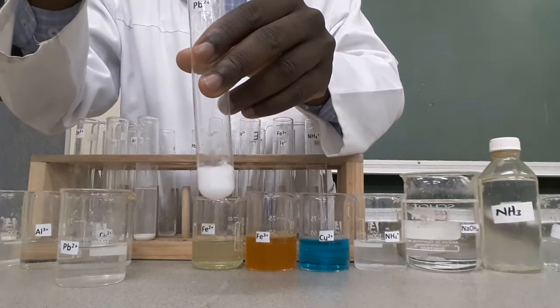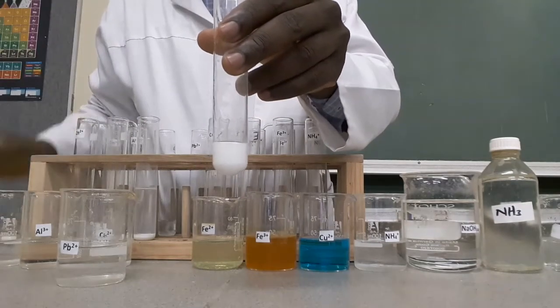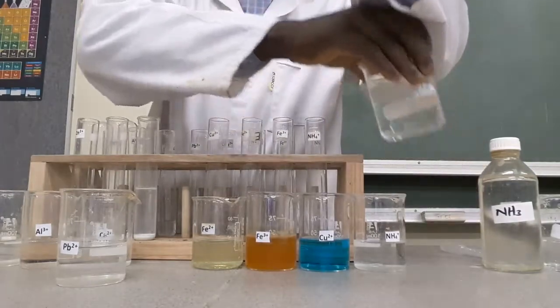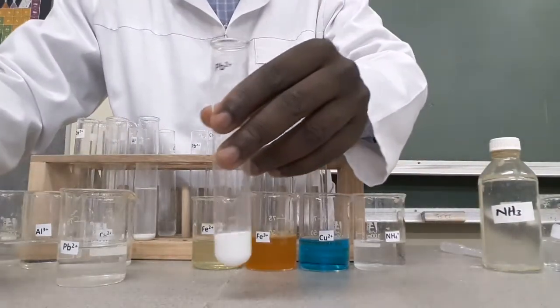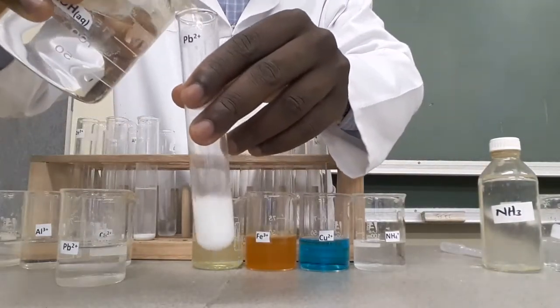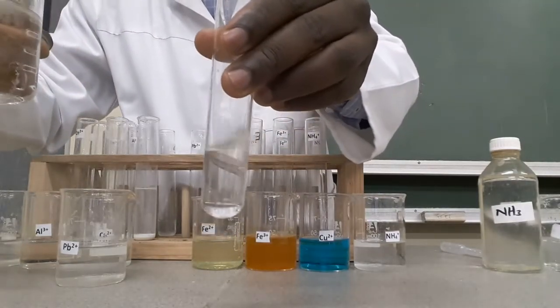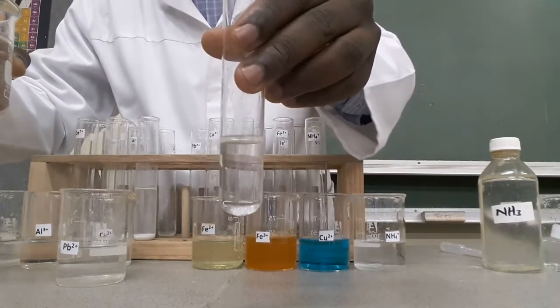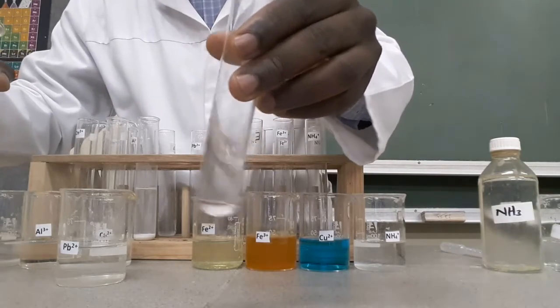Now add excess sodium hydroxide to see the effect on the white precipitate. When we check thoroughly, you can see the precipitate has dissolved in excess sodium hydroxide to form a colourless solution.